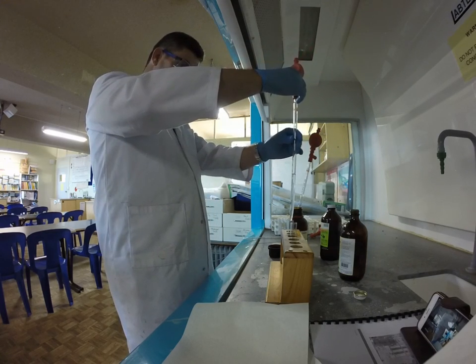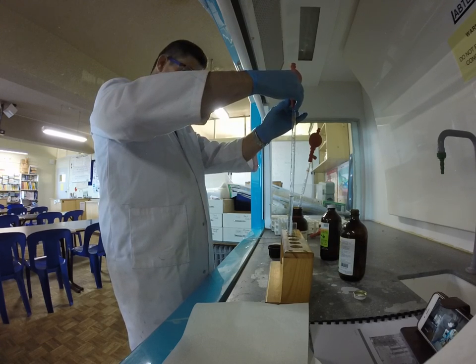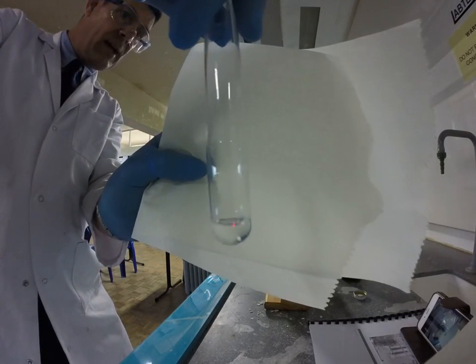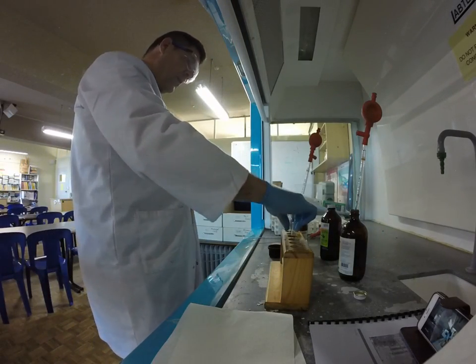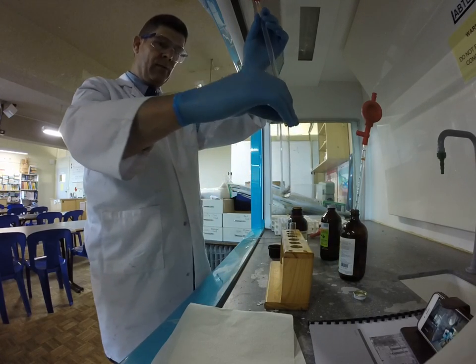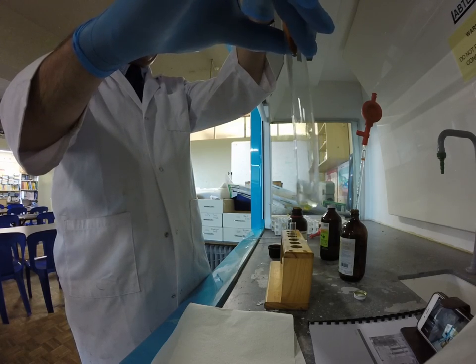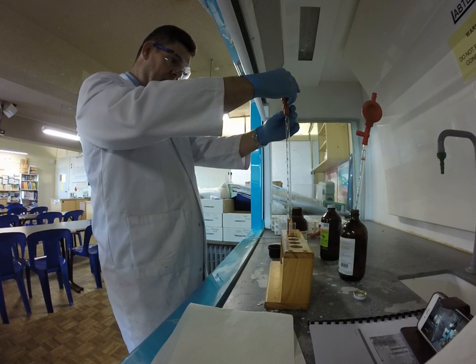I'm only going to transfer about a mil — it's a bit of poor technique here, but I just want you to see this as a qualitative reaction today. Here we have our cyclohexene — it just looks like water. What happens if we add a little bit of our bromine water to it? I'm going to allow some drops to go in, and we can see what's happening: the colour is disappearing quite quickly from the bromine water. Let me put just a few more drops in and we'll see what's going on.